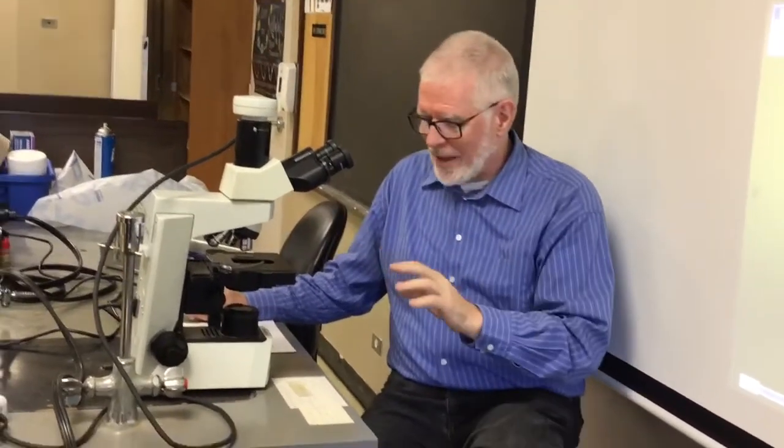Okay, this is going to be part one of the Introduction to Microscope Lab. I will kind of walk you through how these microscopes work. My wife is running the camera, and there'll be times I'll be talking to her to come in and go out. You'll figure that one out.